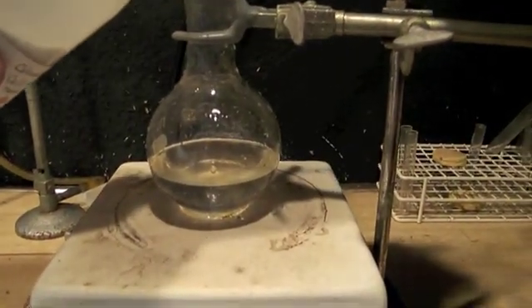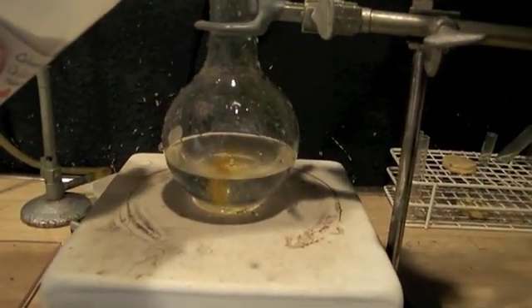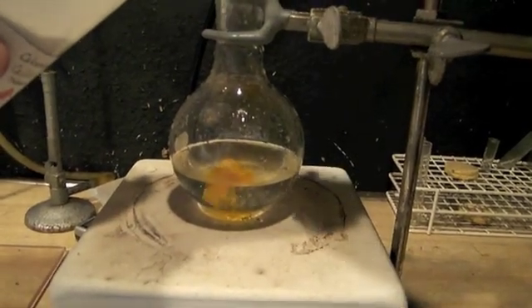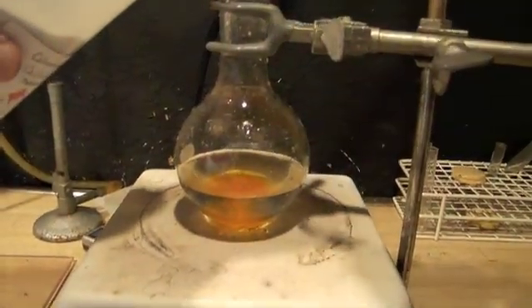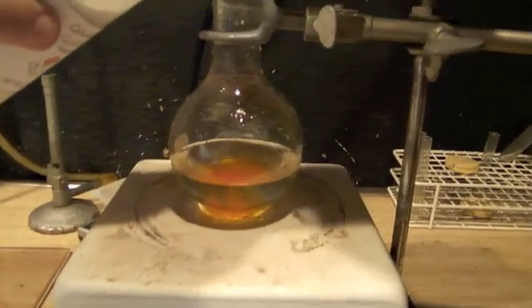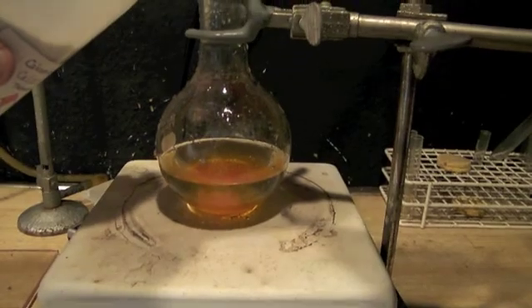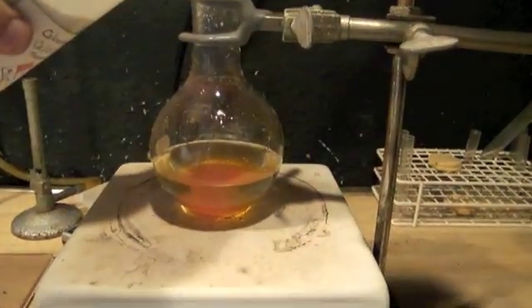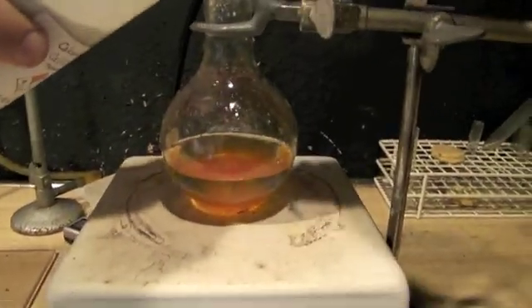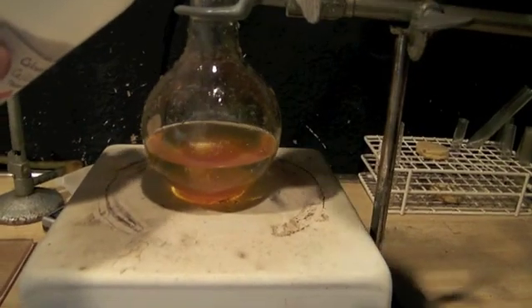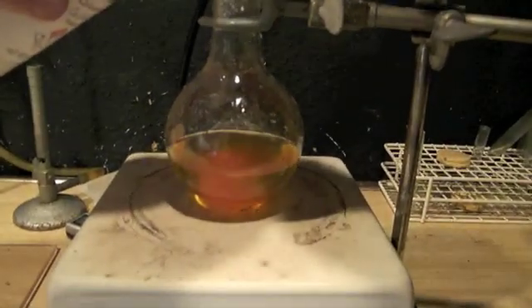At this point, you're going to want to conduct the experiment either outside or in the good fume hood of which I spoke. You will now add the calcium or sodium hypochlorite to your hydrobromic acid. As you can see here, the hypochlorite will oxidize the hydrobromic acid to elemental bromine.